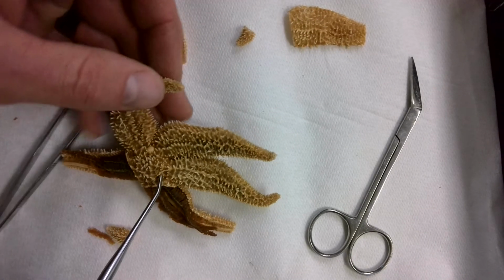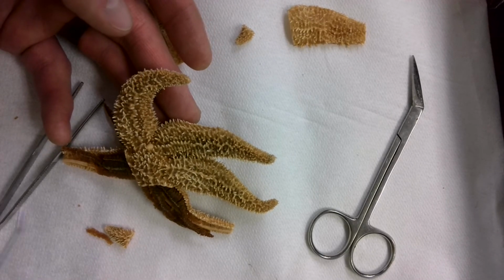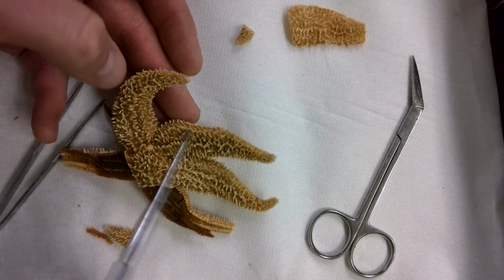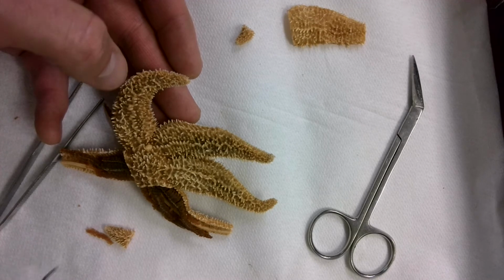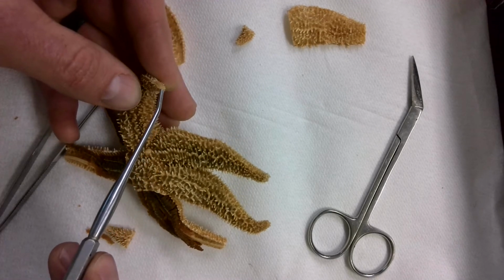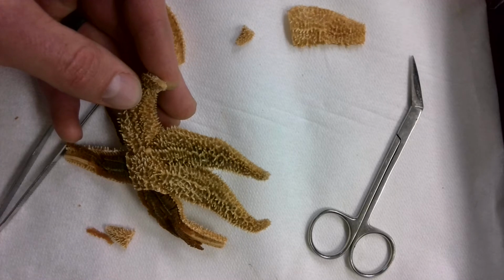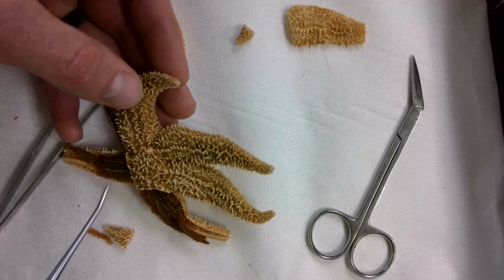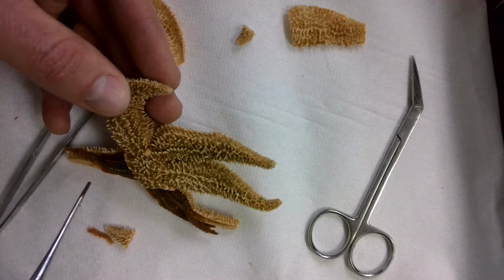So when we look at a sea star, each one of these arms, the name that is given to these spiny skin creatures is called a ray. So you've got 1, 2, 3, 4, 5 rays there. At the end of each ray is an eye spot. Now these are not an eye like what we think of as an eye, but rather they use them to sense their environment. Then you can see right here you have this circular structure that's called the madreporite.